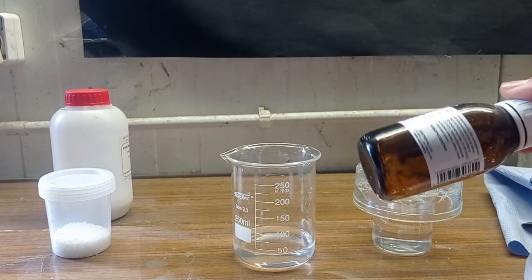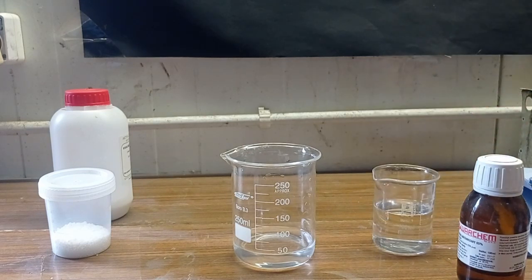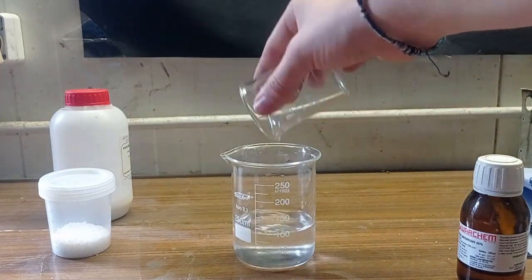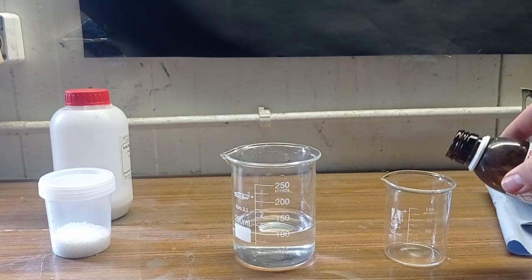Here's my diluted acid, so I just washed the bottle. And here's concentrated 85% acid. I definitely should use gloves, but I don't have any, so I have to be careful with both the acid and sodium hydroxide.